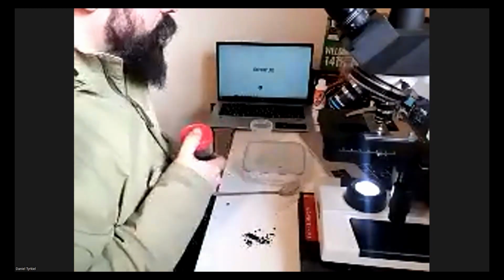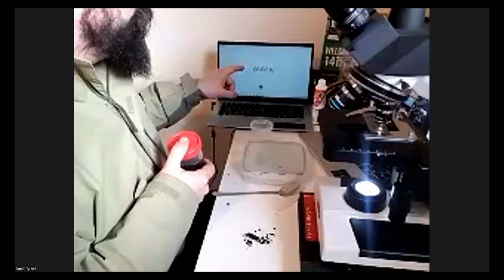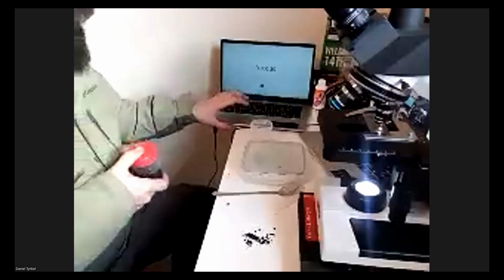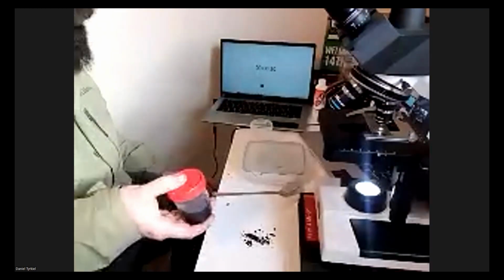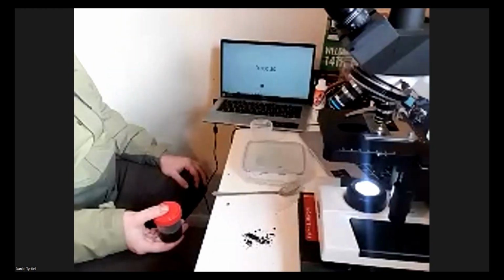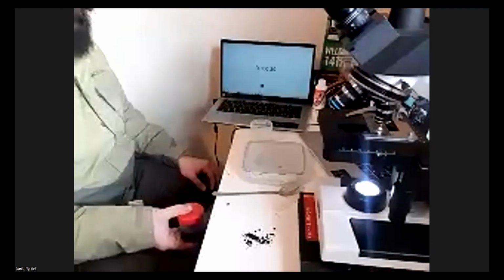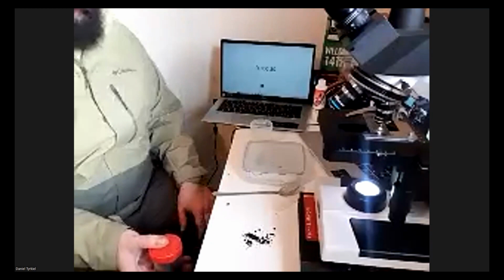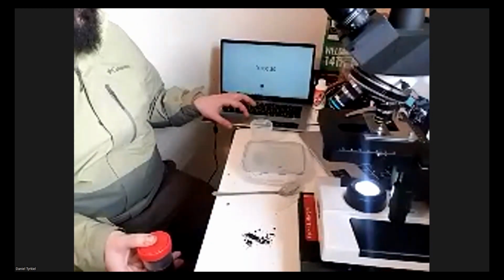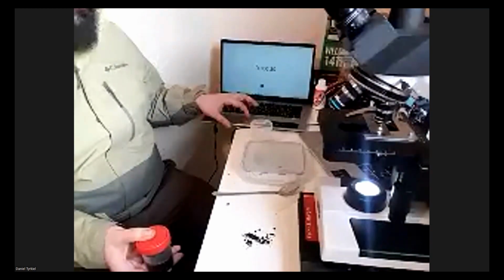Cool. So now we're going to shake it for 30 seconds. We have a timer. You can see over here, set to 30 seconds. And we're going to try and make an angular jerky movement. I'll just demonstrate first. Can't get any closer because the desk's in the way. You can move the phone about. Yeah, true, but I'm just going to go for it. I think this demonstrates what we need to do.